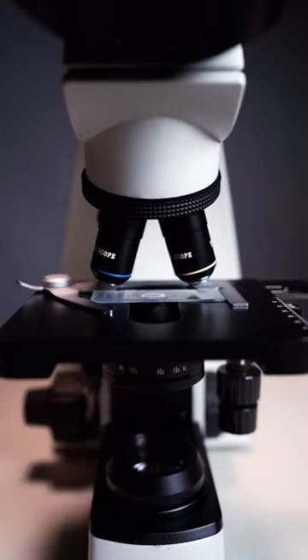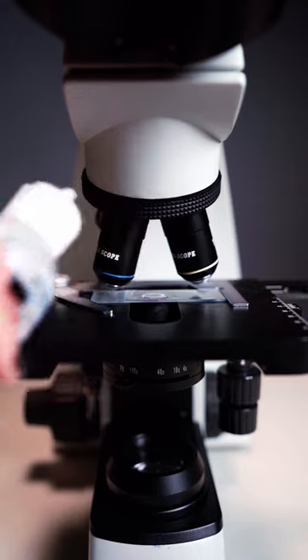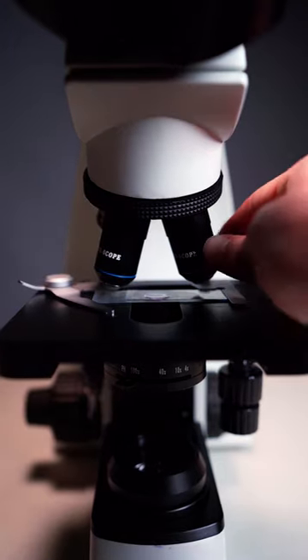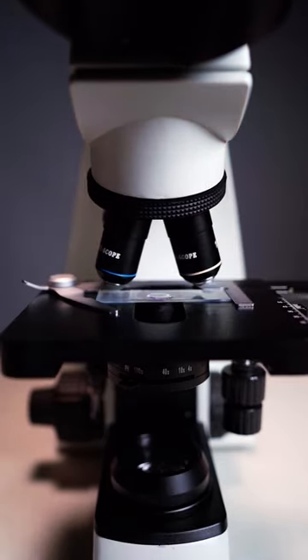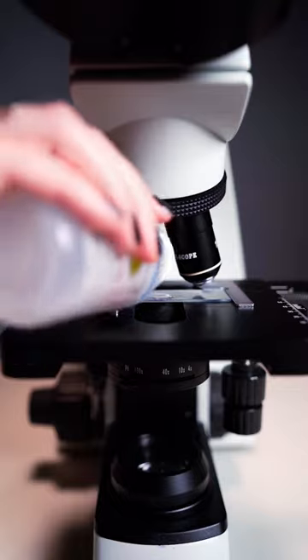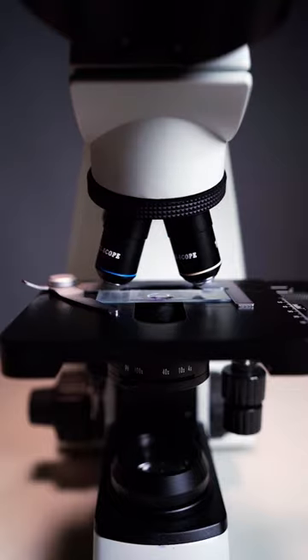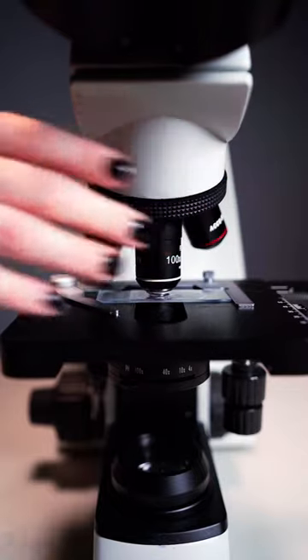You will use the oil immersion objective or 100x for stained skin, ear, line prep urines, mass samples, and many others. We typically use the high power objective or 40x for wet mount urine samples.